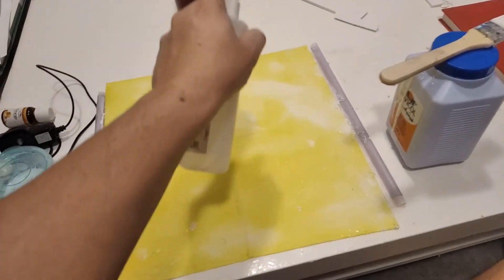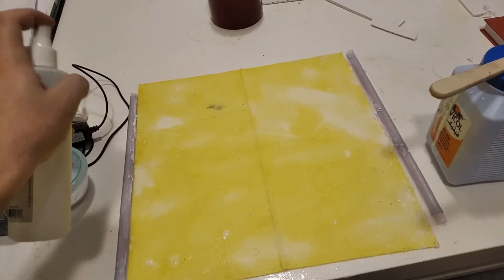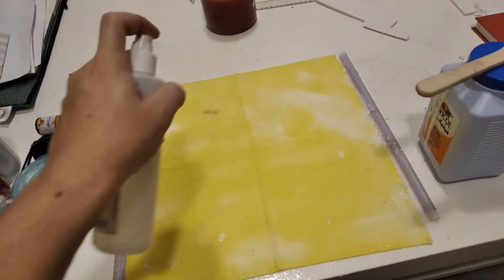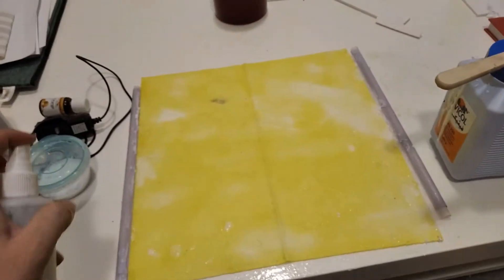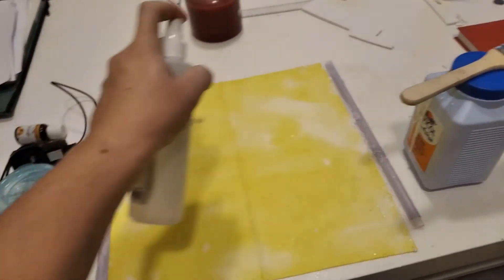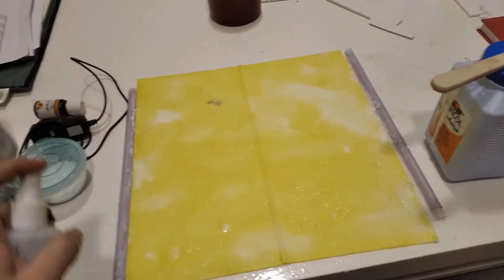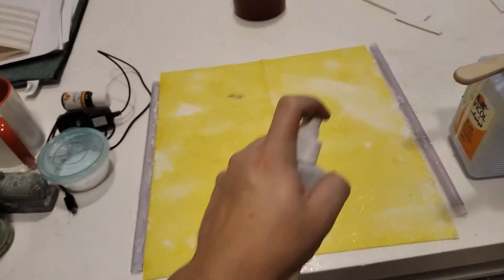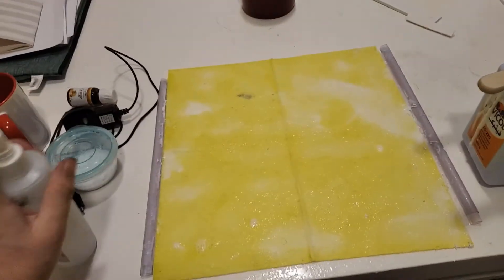You can apply more layers if you want, but it's better to apply two layers, dry, then apply the rest of your layers. This is to ensure that you get a more even coat later on.